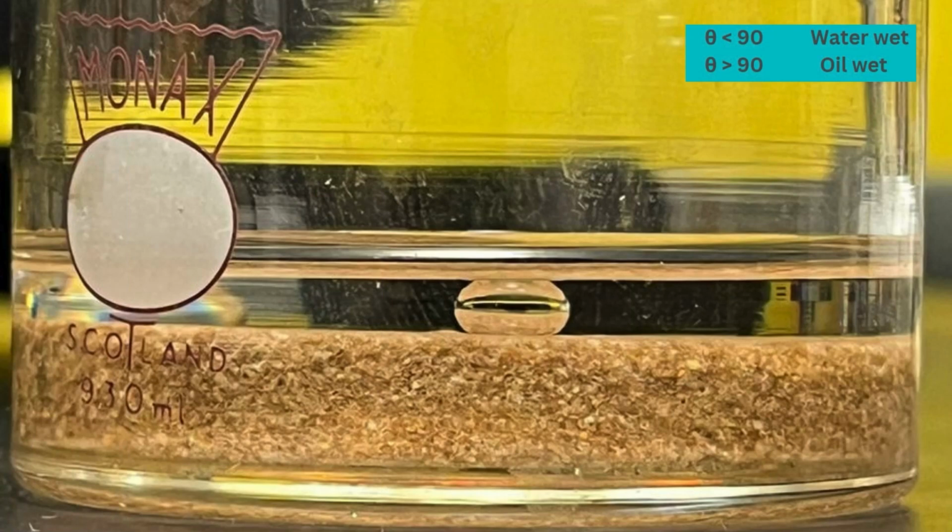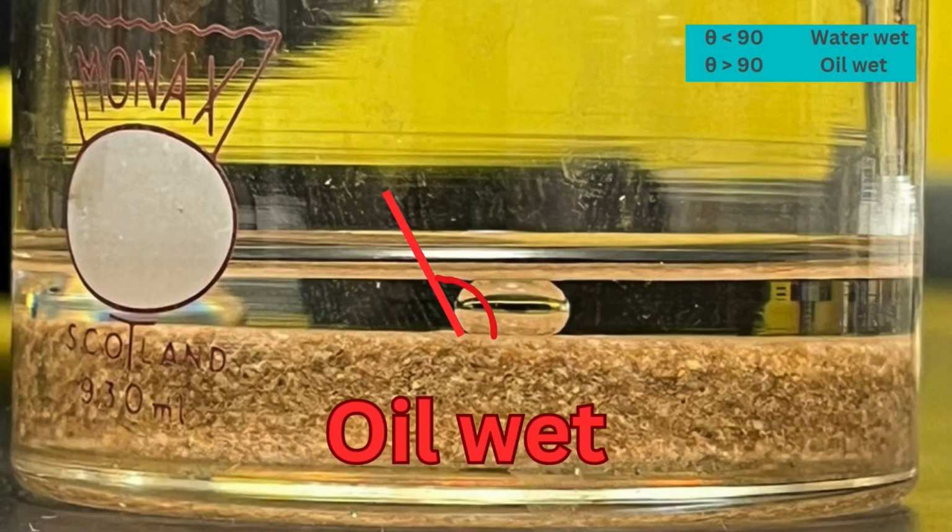And as you can see in the picture, we can now take the contact angle for it. We took the angle of the denser fluid, which is water, and the angle here is greater than 90, so it's oil wet.